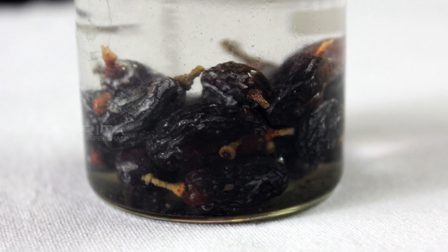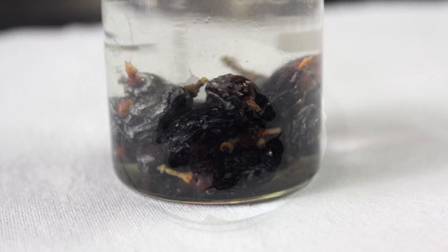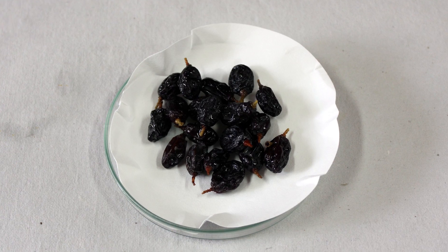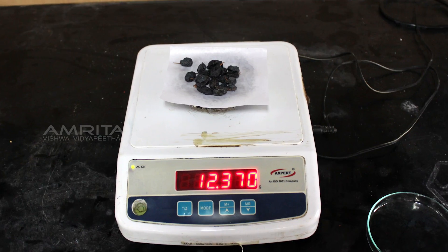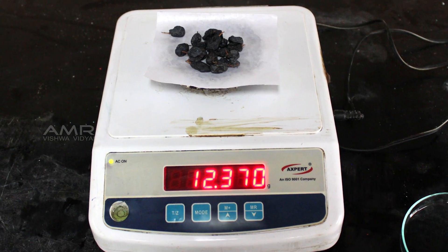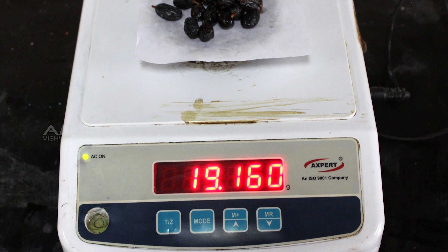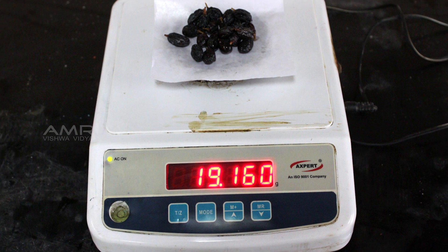The raisins swell up when soaked in water due to imbibition. After the raisins have soaked up the water, the raisin cells become fully stretched. The difference in mass between the swollen and dry raisins gives the amount of water imbibed by the raisins.